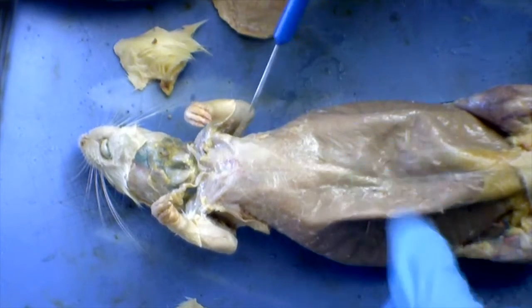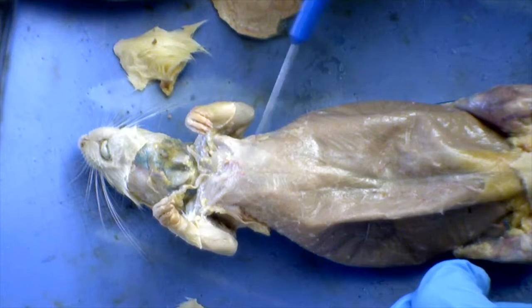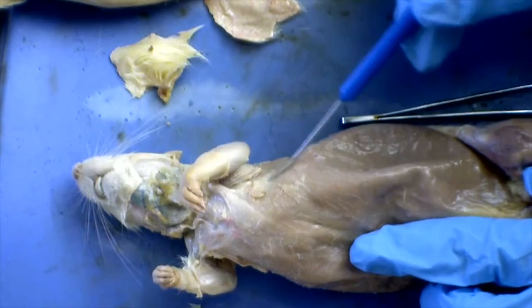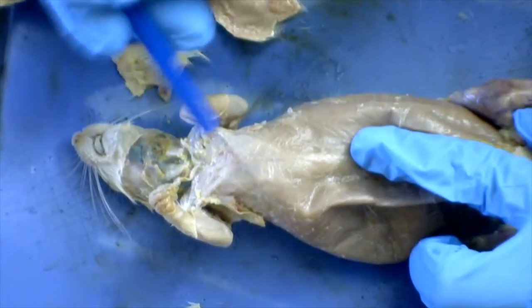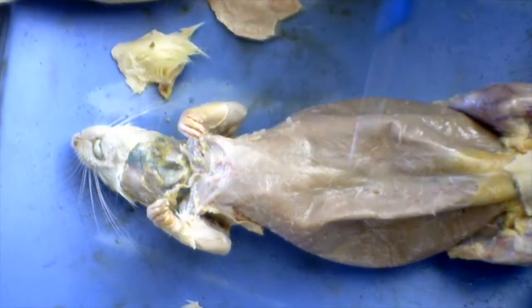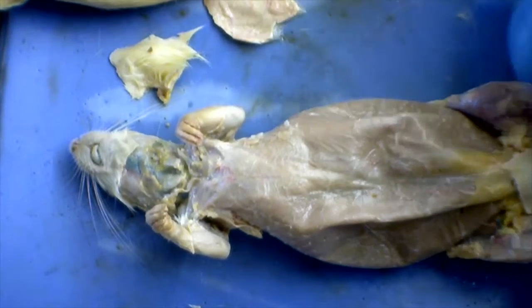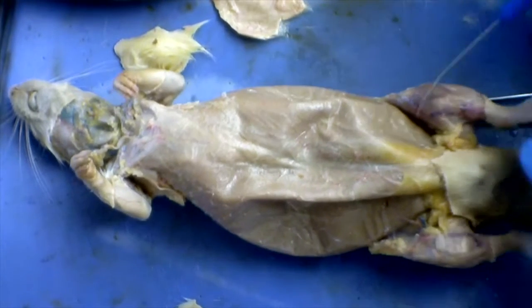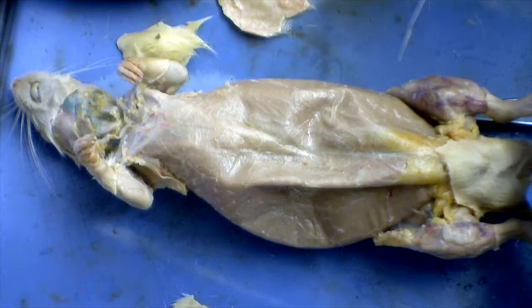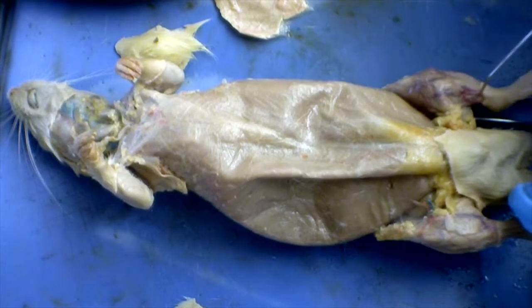And then your pecs, your pectoralis major and your pectoralis minor, are both located here. They're the big chest muscles of the rat. And also on the sides, an easy thing to see is the latissimus dorsi and also the cutaneous maximus. Here we have the rectus abdominis, which is basically like the stomach muscle, or the muscle that goes on the outside of the abdomen. And then on the back legs we have the rectus femoris, which is located right here, and the gracilis, which is also located in the inside of the legs.